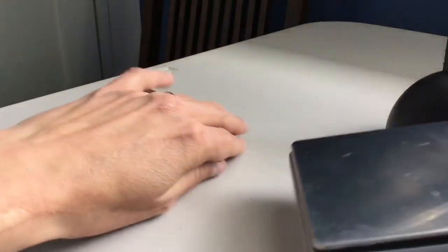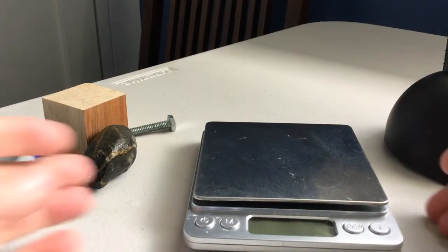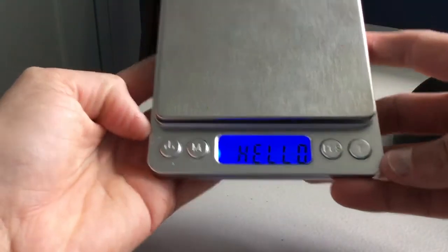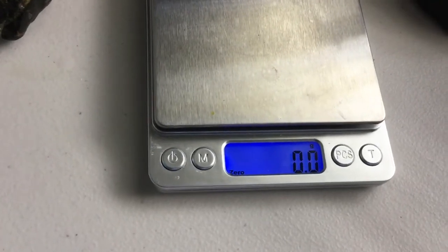We have what is called an electronic balance. And I think that we've used these before a little bit when doing the Cold Pack Engineering Design Challenge. We did that. And so this is basically something that measures mass, that measures weight, right? When I turn it on, here, let me lay it flat. When I turn it on, it'll say hello, and then it'll say 0, right? So we want it, and it has grams.